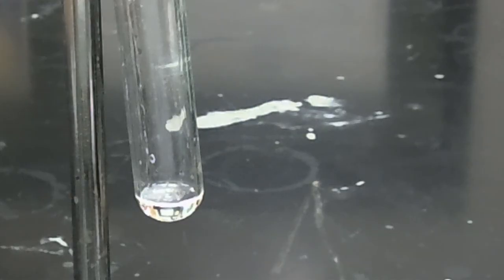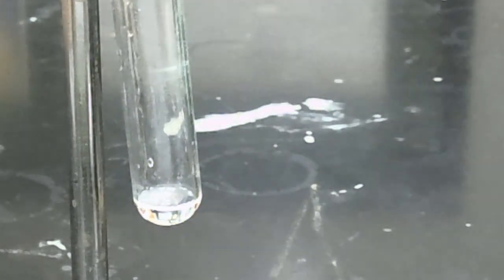And now what we're going to do is add a small volume of concentrated phosphoric acid and record our observations. So as we can see, when we add a solution of concentrated phosphoric acid to our ethyl laurate sample, the ethyl laurate dissolves and we get a homogeneous solution. From these observations and the provided data in this recording and on Canvas, you have all the information you need to complete this laboratory.